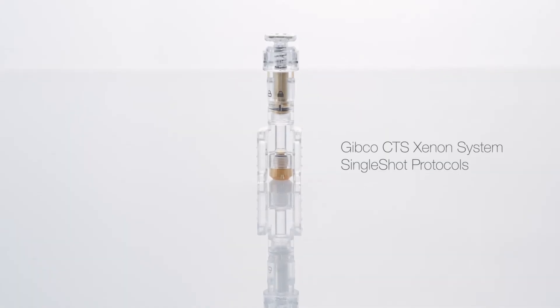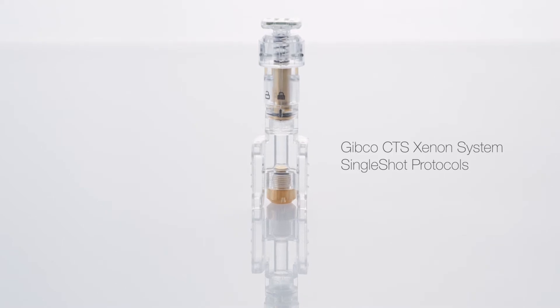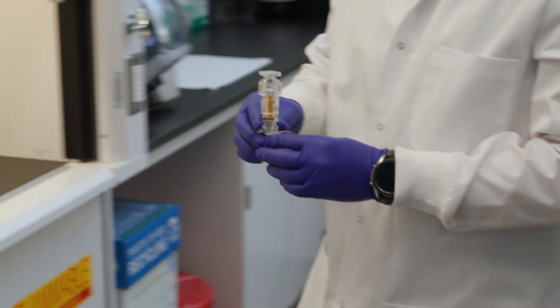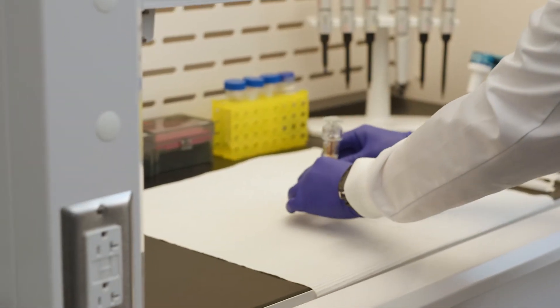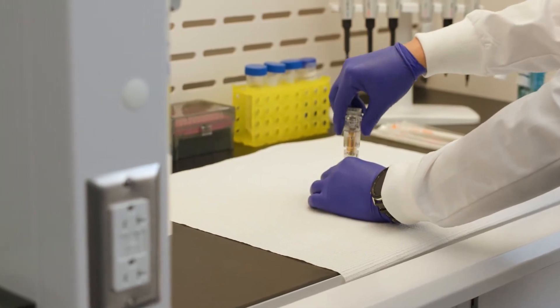Single shot protocols are used to prepare 20 to 100 million cells in a 1 milliliter sample volume. To avoid contamination, prepare the chamber in a cell culture hood using aseptic technique.